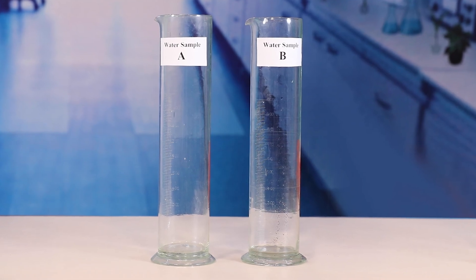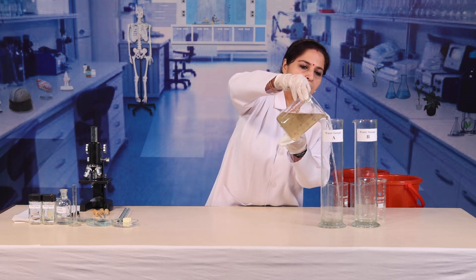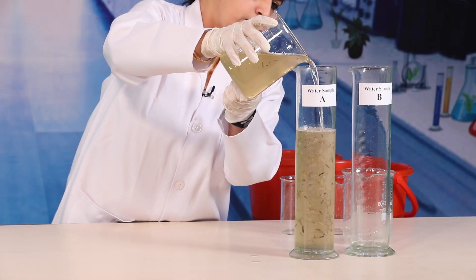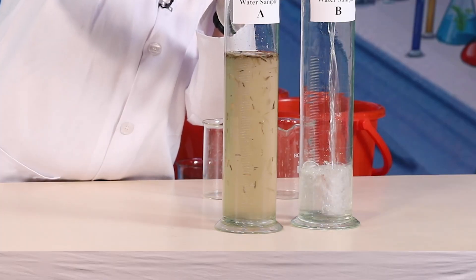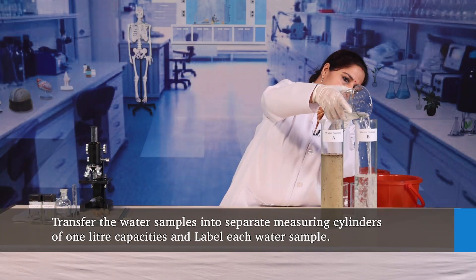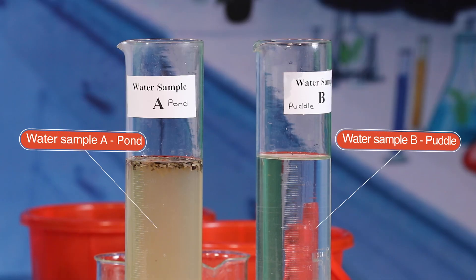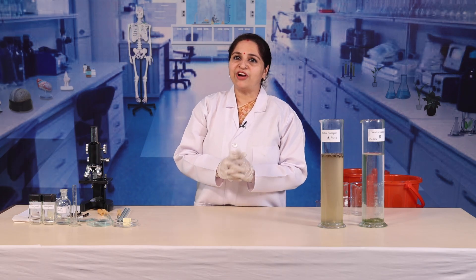In the laboratory, transfer the water samples into separate measuring cylinders of 1 litre capacity. Label each water sample to indicate the size of the water body and the site from which the water sample has been collected. Add about 5 ml of FAA to each sample in order to fix and preserve the organisms present in the collected samples.